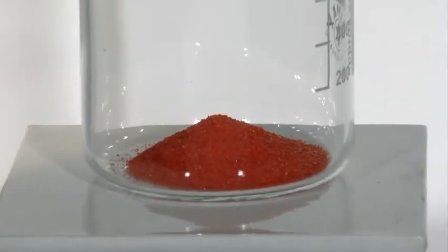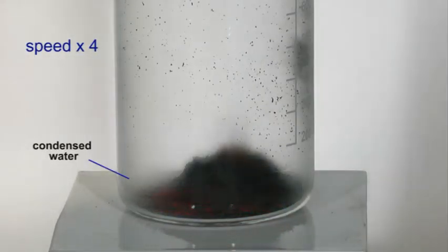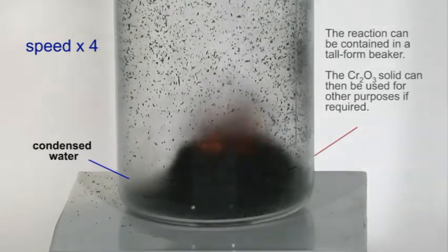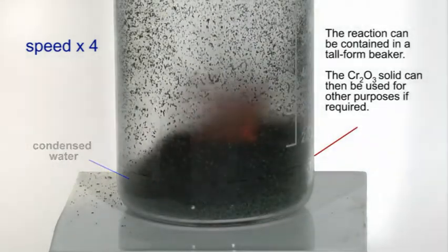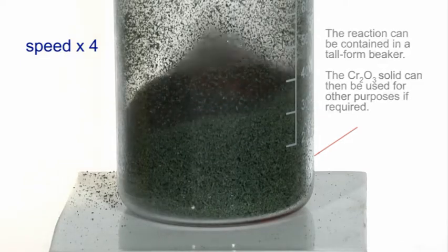The reaction can be effectively demonstrated by containing the compound and its products in a tall-form beaker. You can also clearly see the water vapour that is produced in the reaction.